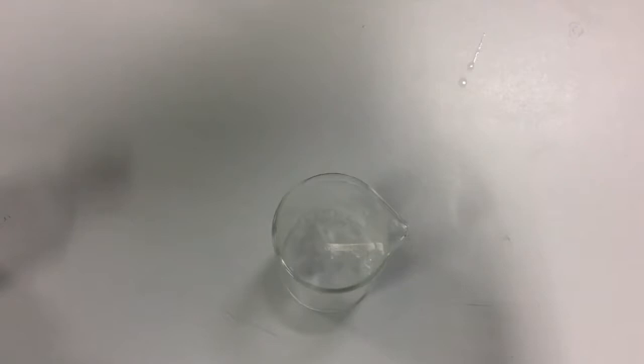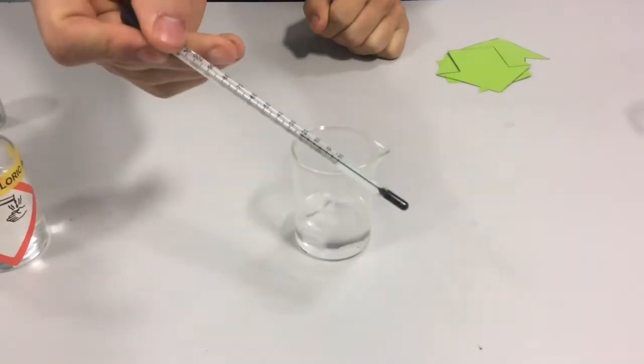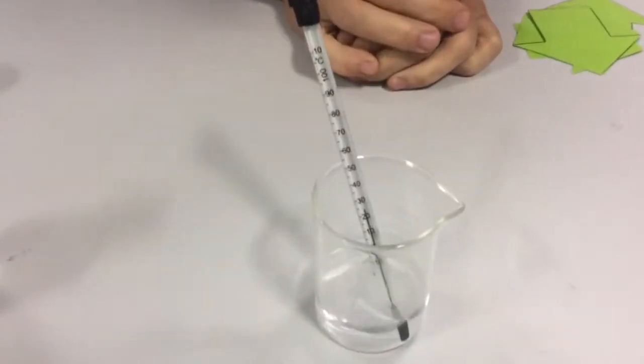Something's happening to let us know that it's a reaction. What is that gas that's being released, do you think? Now if I pop my thermometer in there, we can see that it started off around 23 to 24. Pop it in there, look what happens to the thermometer's temperature.